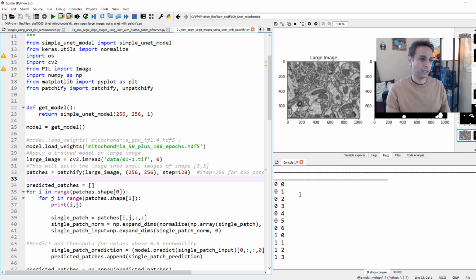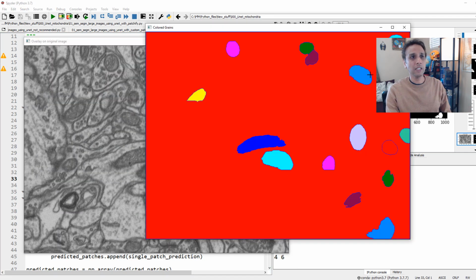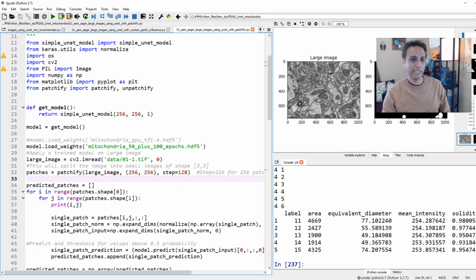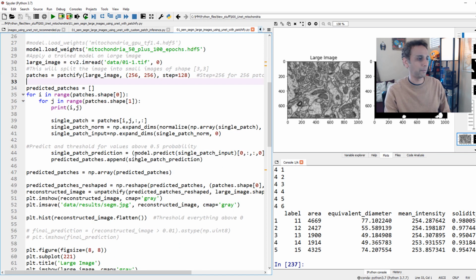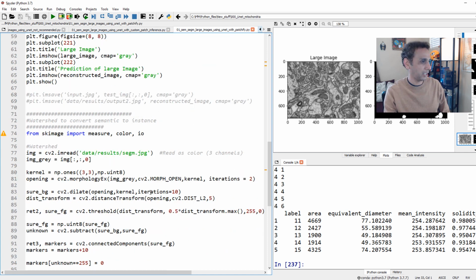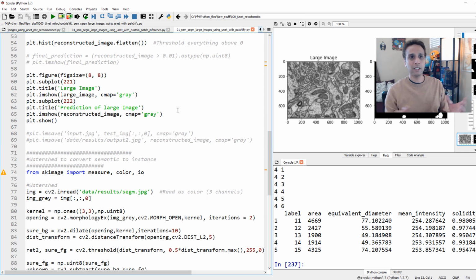I hate to extend the video, but this can be educational. So now you can see we have a lot more patches. Yeah, so the result is not bad actually. The result is pretty good even here. In fact, it's probably better than the other one, but I'm not sure. Let's see. No, it's almost identical actually. This is suspiciously identical to the last time's results. I'm just checking if I made any mistakes, because the results look very identical, but they are slightly different. Now I'll let you actually work with 64 by 64 size images, and then see when you put them together if you actually get similar results, if not identical results.